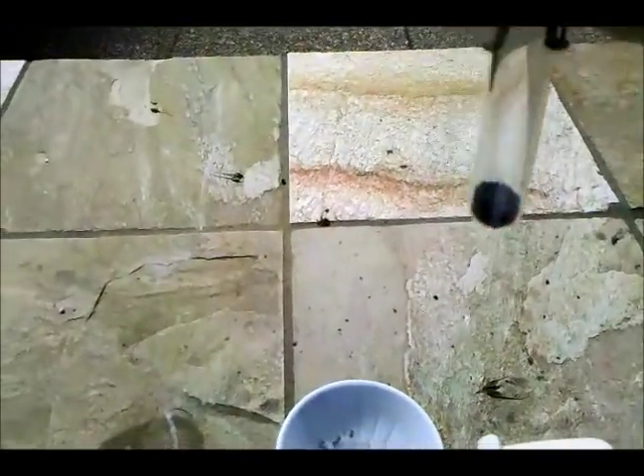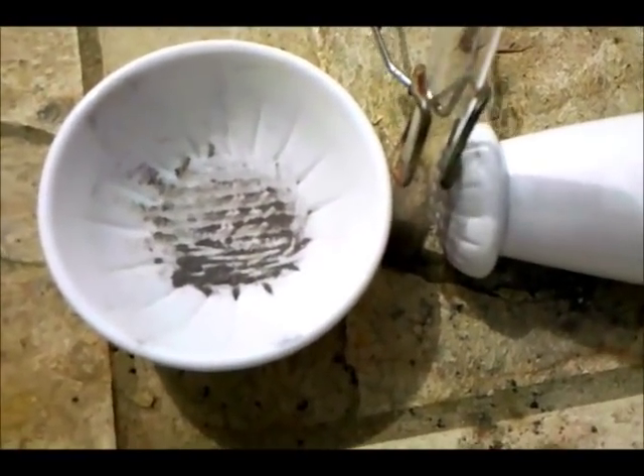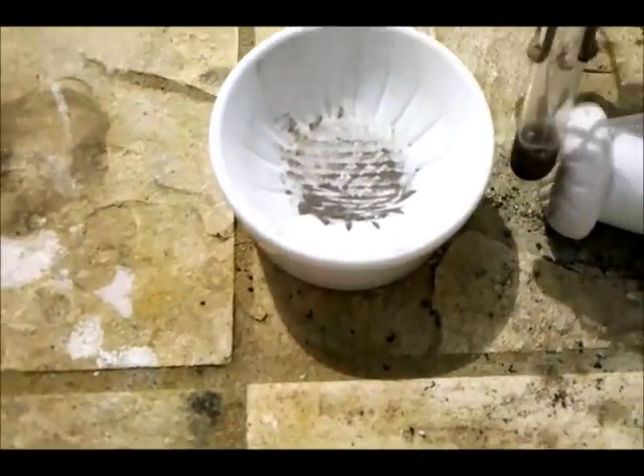So I've added the sodium hydroxide beads into there and I'm adding some water. The silicon needs to be pretty fine for this to work well. We can see some bubbles forming on the side of the test tube, and if I shake it there are some larger bubbles being produced. So hydrogen is being produced.